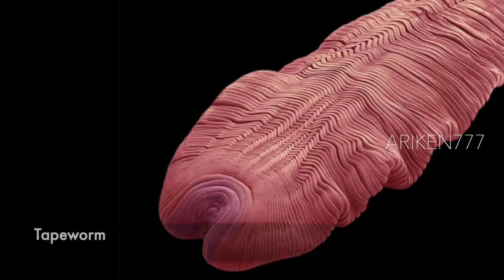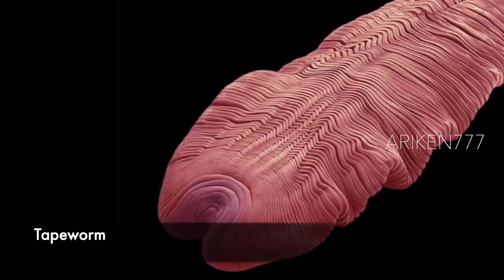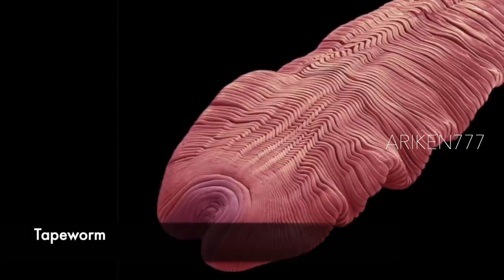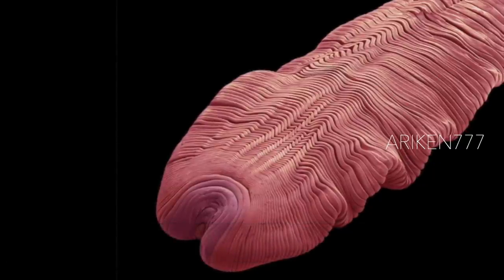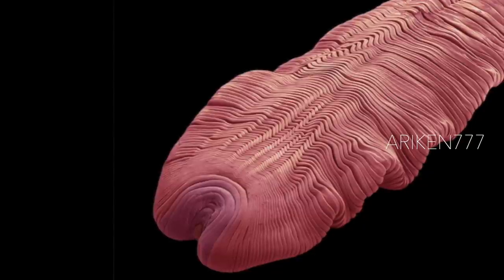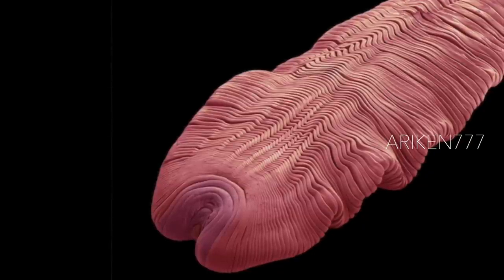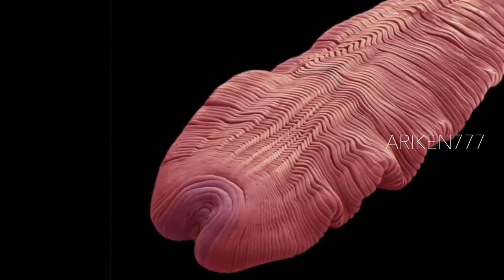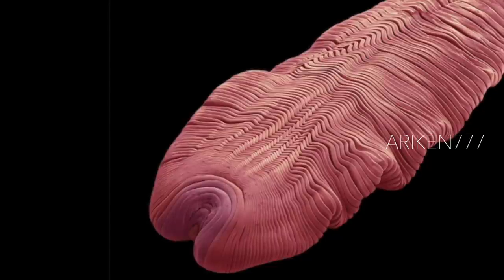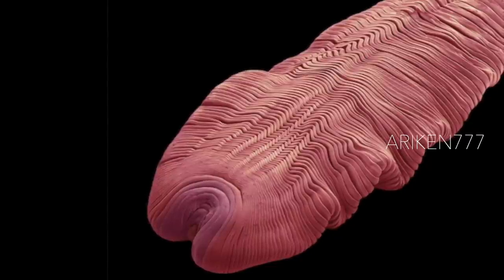A tapeworm in the cysticercoid stage. Tapeworms are parasitic flatworms that live in the digestive tract of their vertebrate host. The larvae develop into the cysticercoid stage in the host's liver and intestinal tissue.